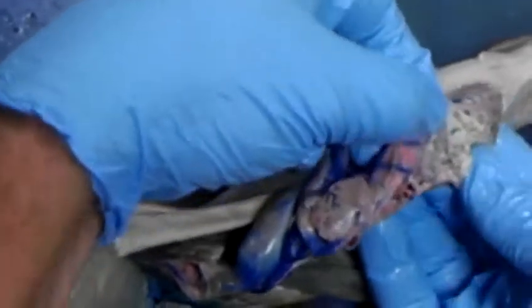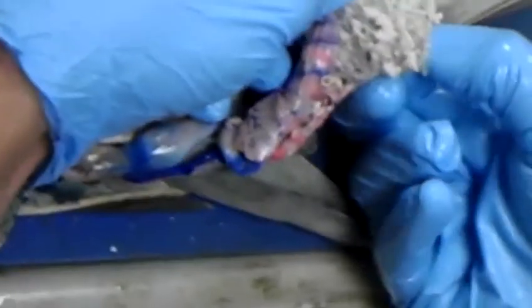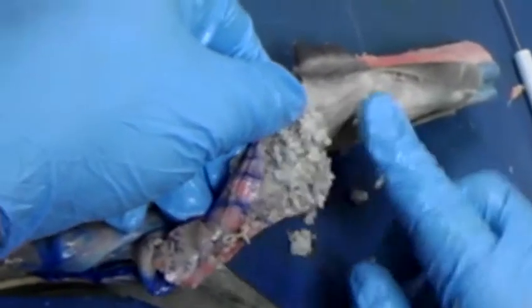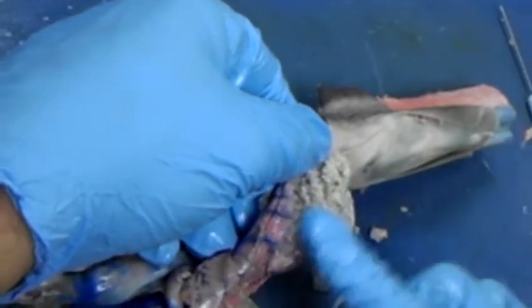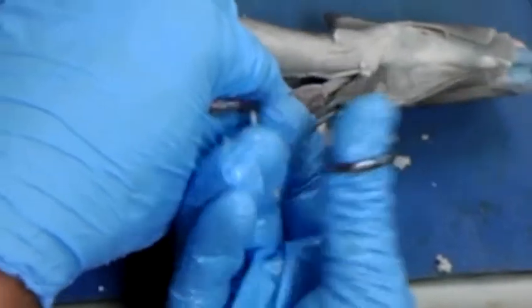Now when we open it up, you'll see that it's partitioned. You make out those partitions? Spiral valve. That's the spiral valve. That's allowing food to go in a corkscrew fashion to increase residency time, to increase absorption. Does it have that so it doesn't have to have a super, super long intestine? Right. This is one way to increase residency time without having a convoluted small intestine like we have. Then after that, it will go into the large intestine.